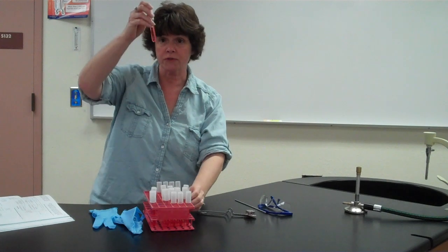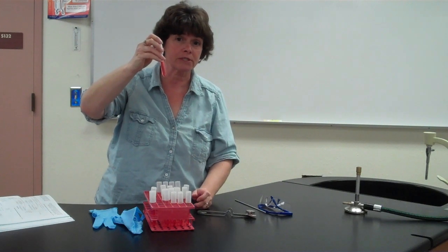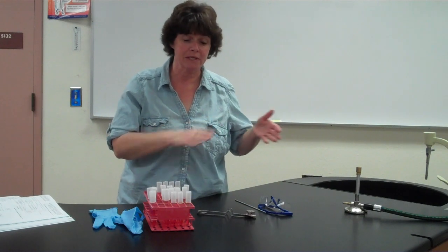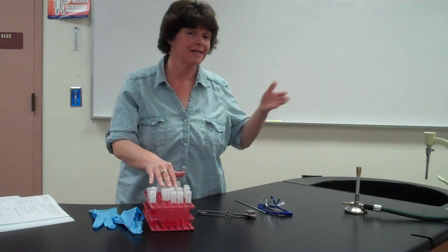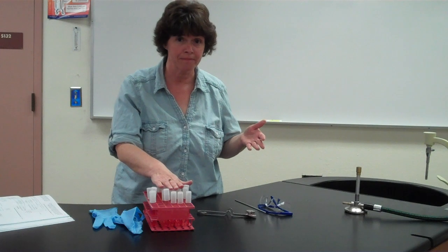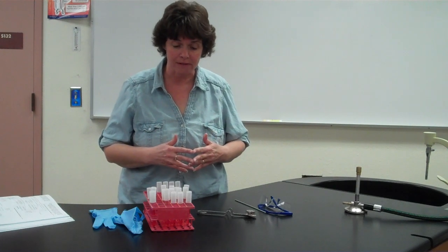You're going to have controls, so you'll be able to compare to the control to see if there is a change in turbidity and also to see what the color change is. I mentioned that it has a basic reaction also. If it raises the pH because it doesn't use sugar, but it might use the peptone in the media, it might turn more of a pink color. That's not a positive reaction because we're looking for fermentation, which will go acid. So there are a lot of different results. This is a very differential type of media and it could tell a lot of different things.